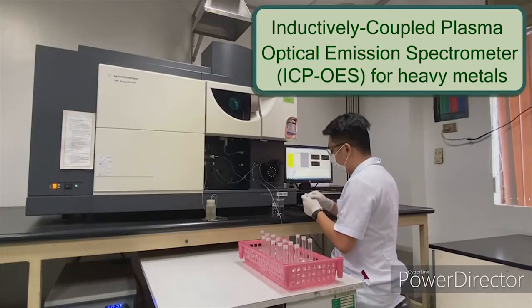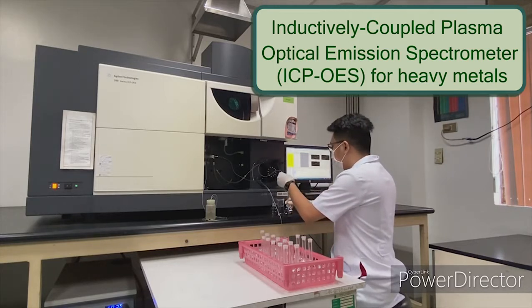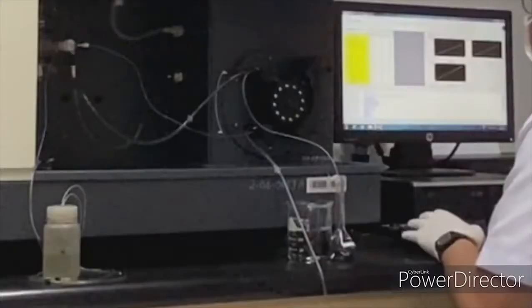For heavy metals, the laboratory uses the inductively coupled plasma optical emission spectrometer or ICP-OES because of its capability to determine elements up to trace amounts.